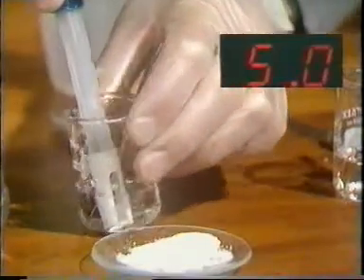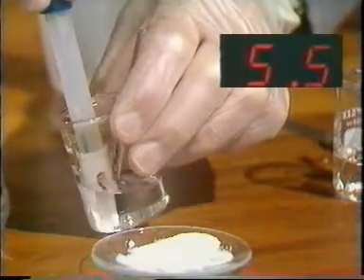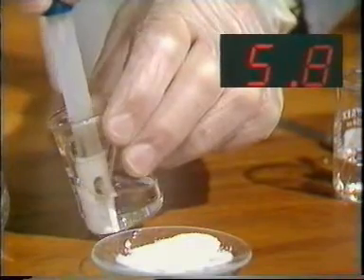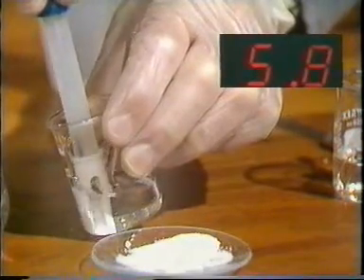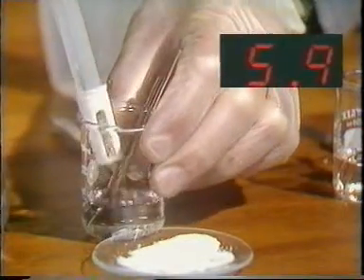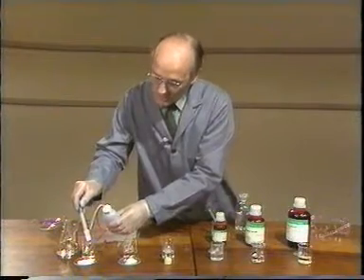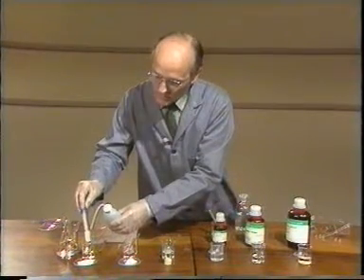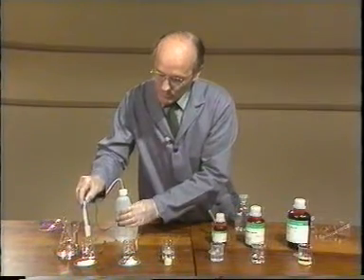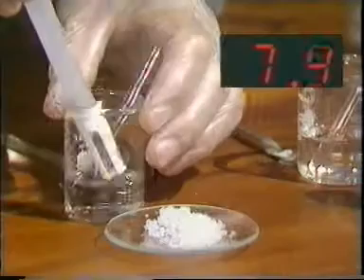Now, sodium chloride. When it settles down, pH of 5.8 or 5.9, which is much the same as the pH of the water that we're using due to the absorption of some carbon dioxide from the air. Rinse the probe carefully before trying the next one.